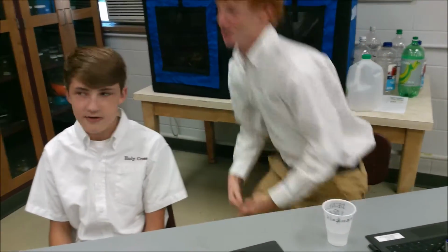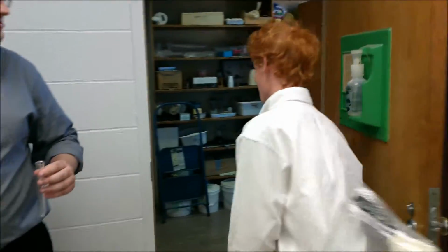Silly Johnny, you have to ask permission first. Okay. Mr. Thomas, may I go get some deadly uranium in the storage room? Of course you may. Thank you. Got it.